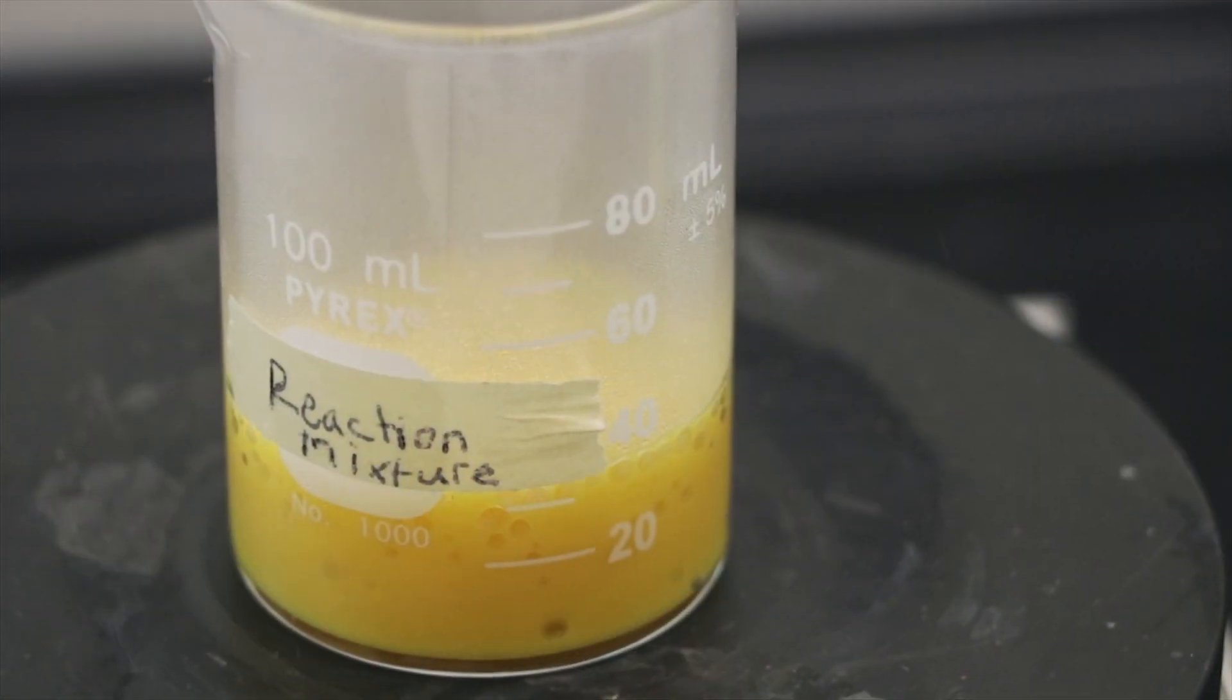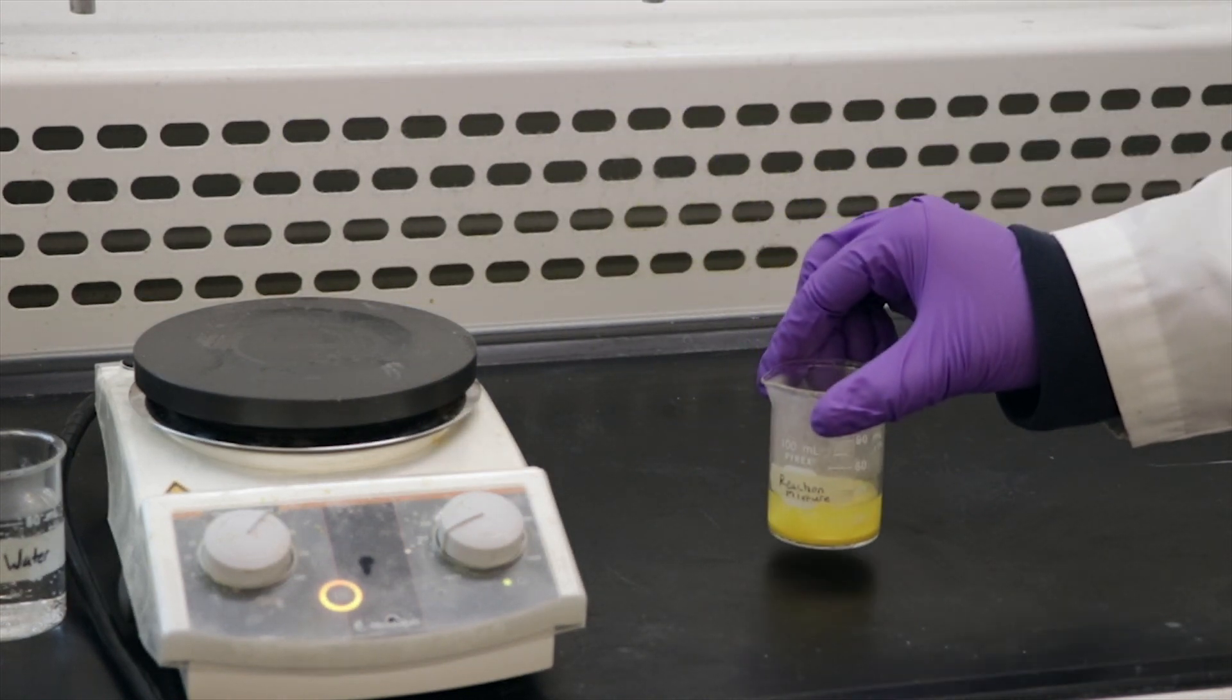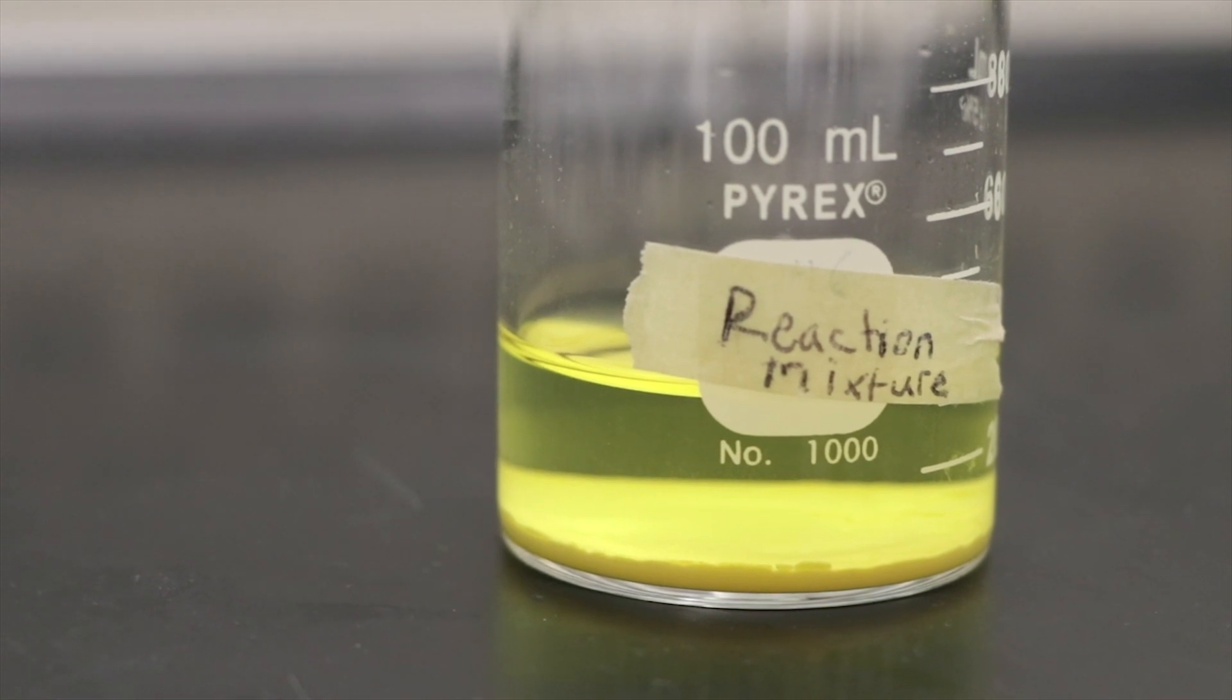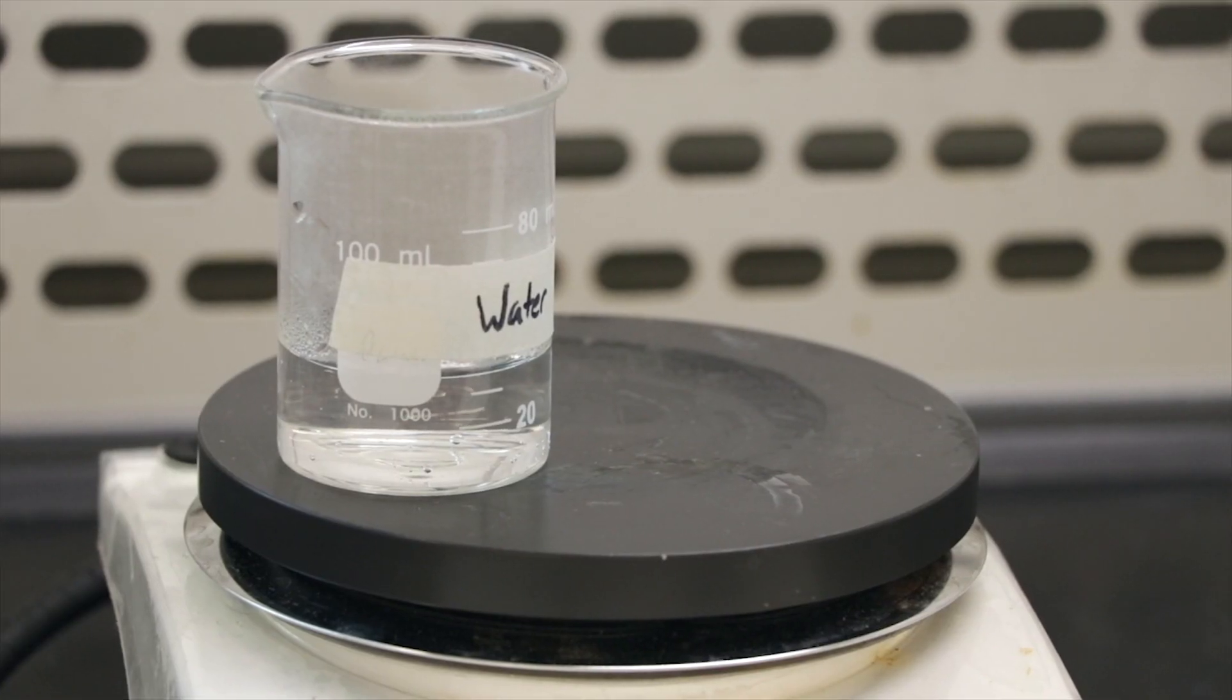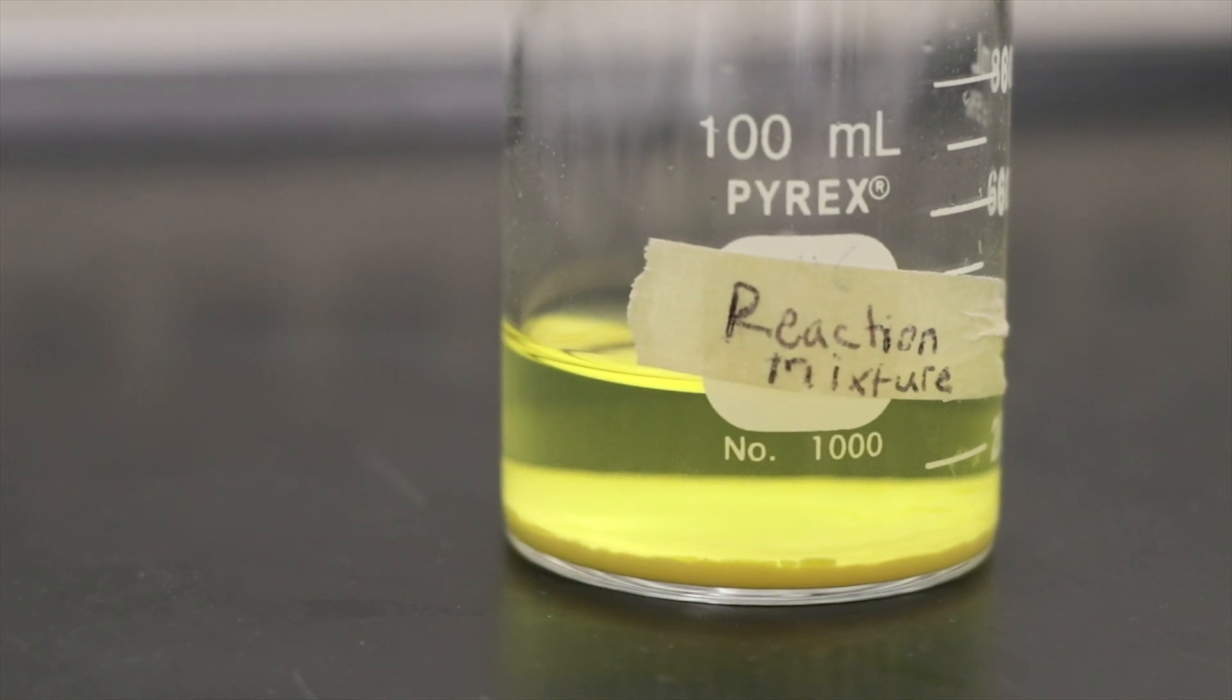Heat up the solution until it is boiling. Remove it and allow the yellow precipitate to settle. This is your ferrous oxalate. Meanwhile, heat up approximately 75 to 85 ml of water. This will be used to wash your precipitate and dissolve the potassium oxalate for the next step.